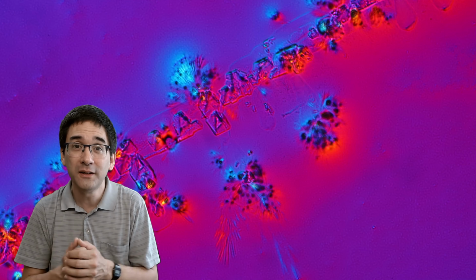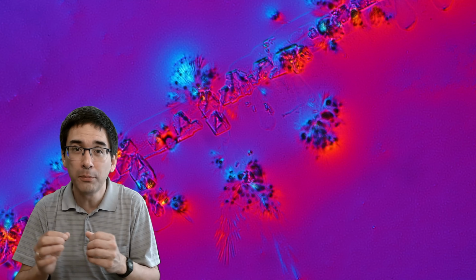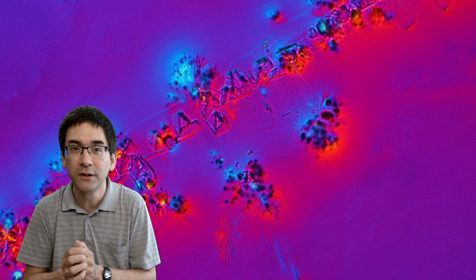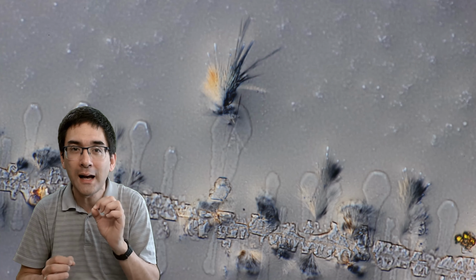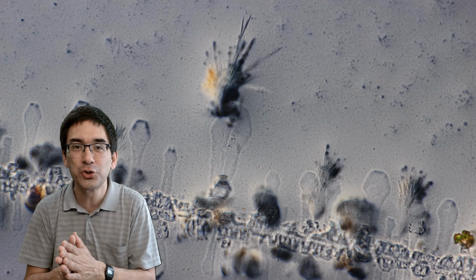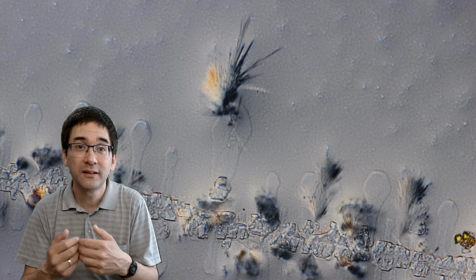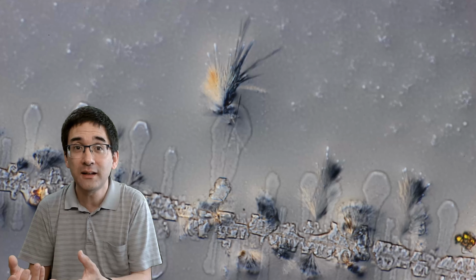Now, what I've done is I placed a drop of urine on the microscope slide and spread it. And I'm going to show you later how I've done that. But when you add a little bit of water, I'm also going to show you that, then the crystals are going to dissolve, and they might recrystallize if you allow the water to evaporate again.